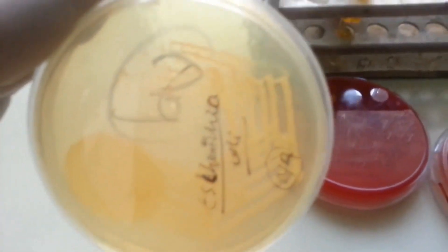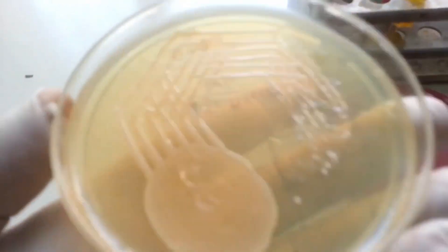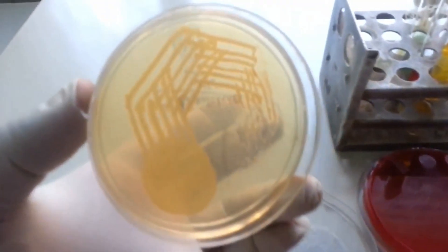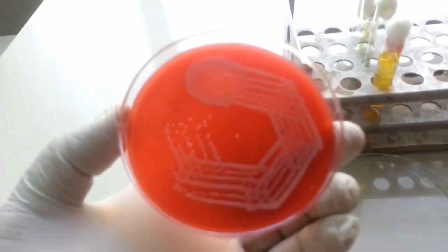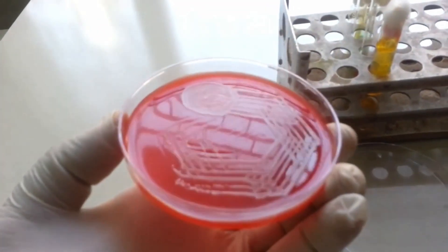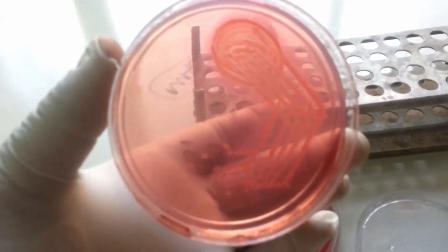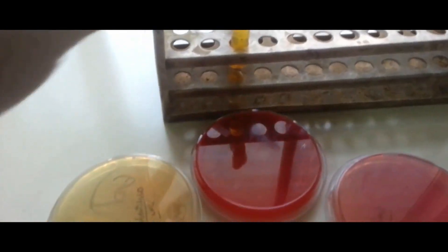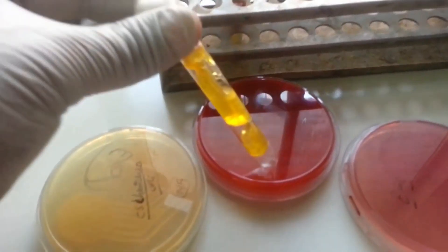That is E. coli growth on nutrient agar, blood agar, and MacConkey agar, which was confirmed by biochemical tests.